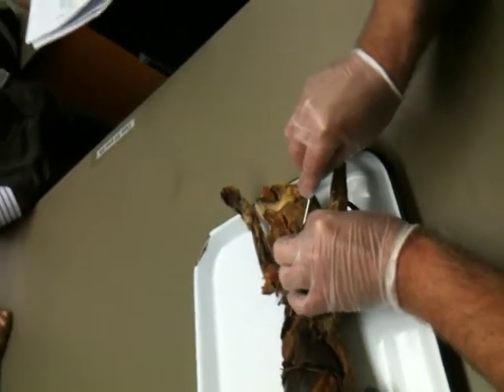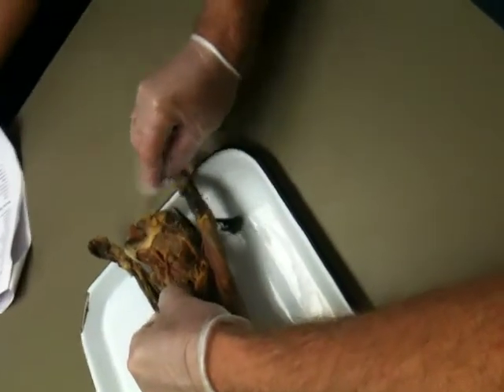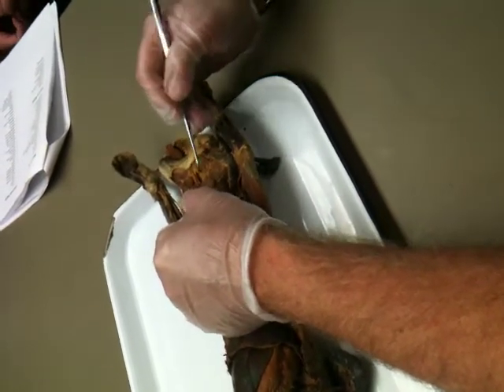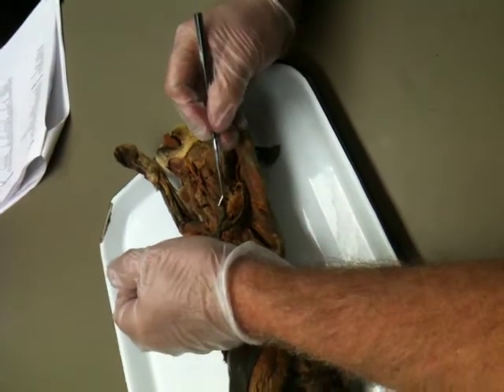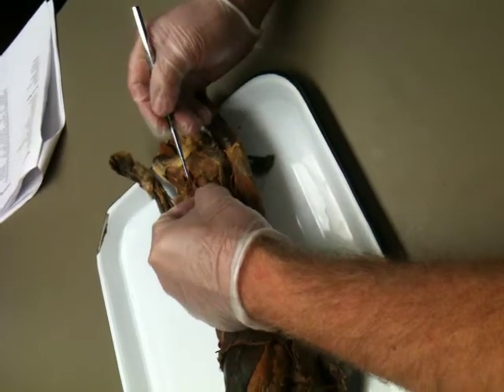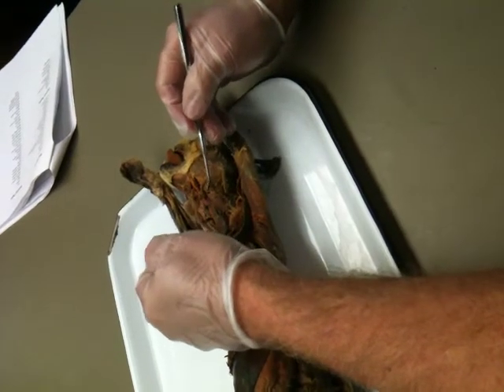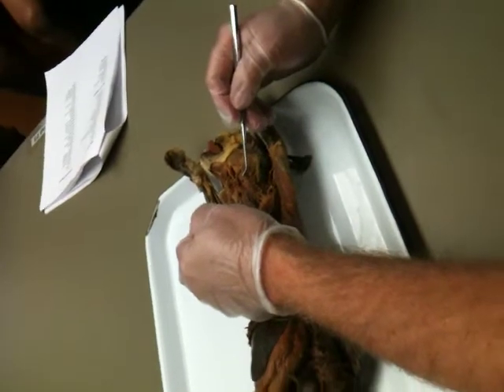This one back here is the submandibular gland. The submandibular gland is usually confused for a lymph node. I don't see a lymph node on this cat. But if you also remember, here's the external jugular, here's the transverse facial, and here's the maxillary, and now back from it, right in that angle, that's where the submandibular or submaxillary gland is.